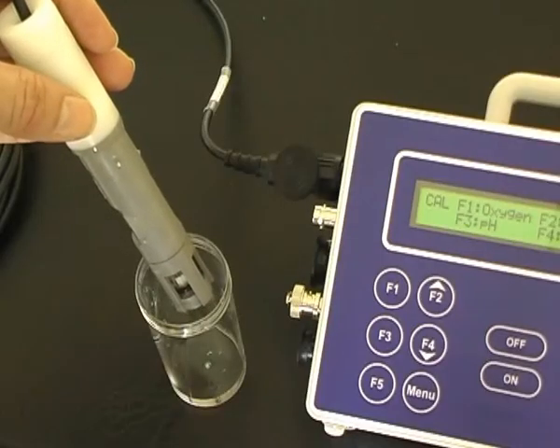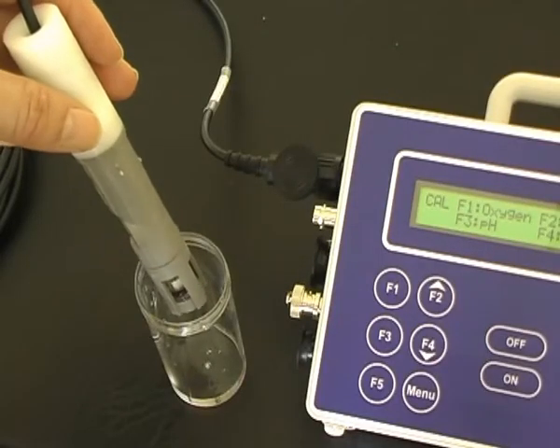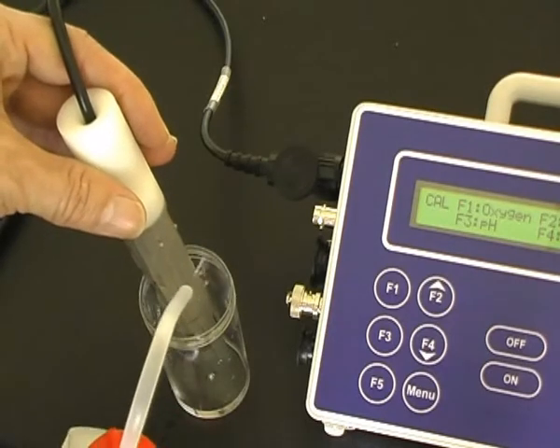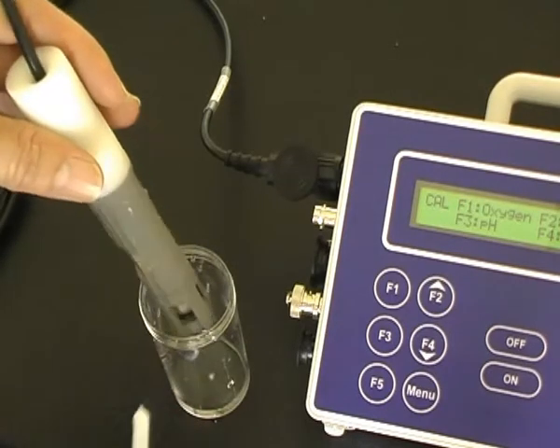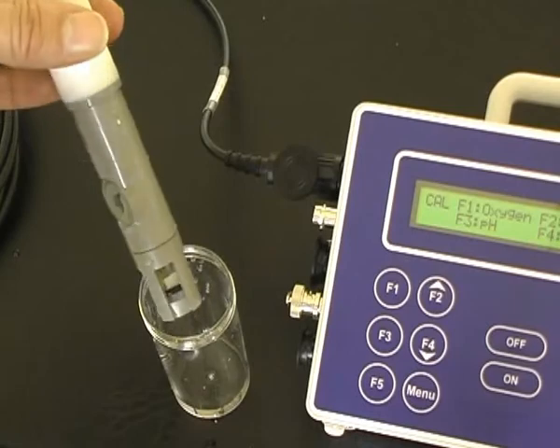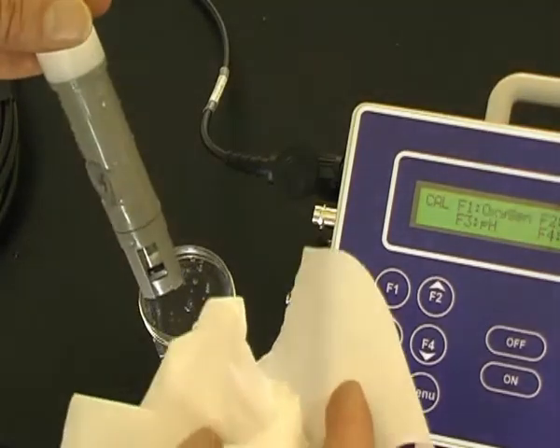Remove the dissolved oxygen sensor from the zero solution and rinse with deionized water. Once rinsed, ensure the sensor is completely dry with tissues.